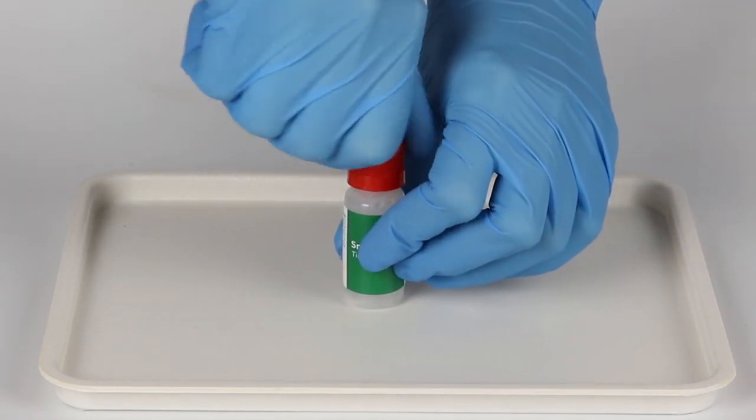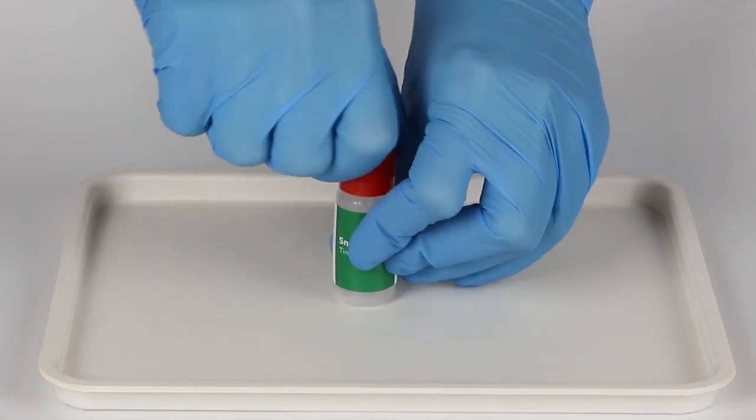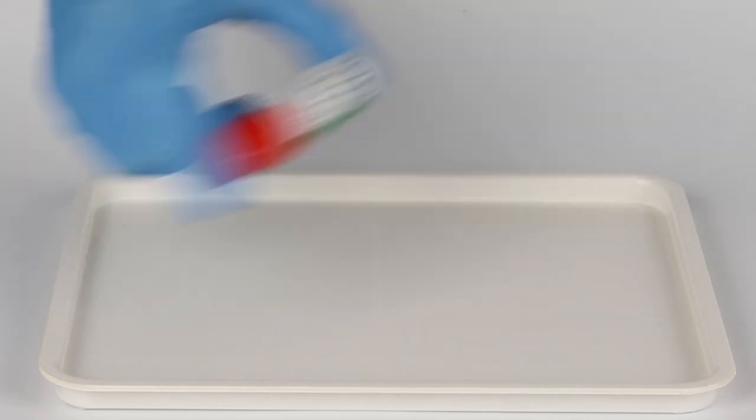As an alternative, you can use the white cap from the bottle of sodium hydrogen sulfate solution. Shake the bottle well to mix the contents.